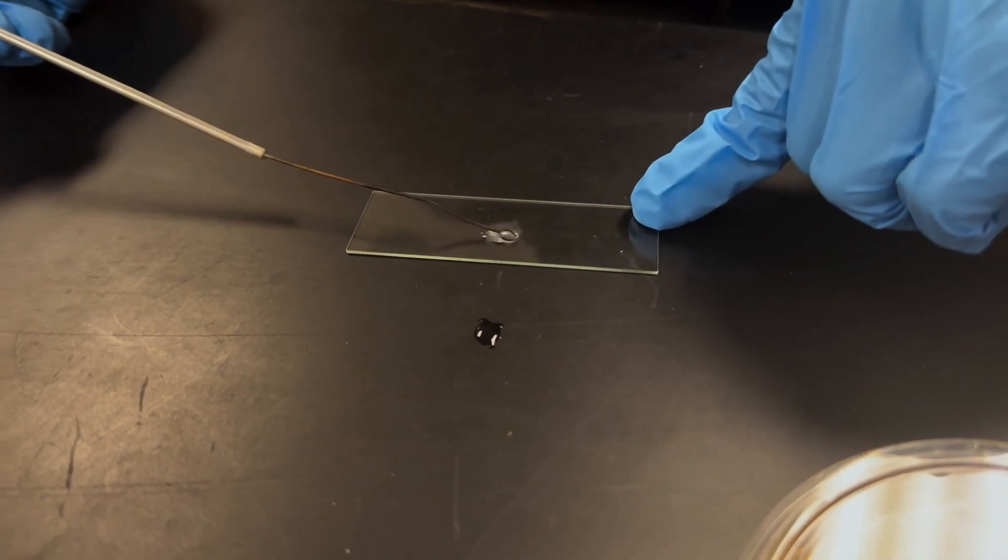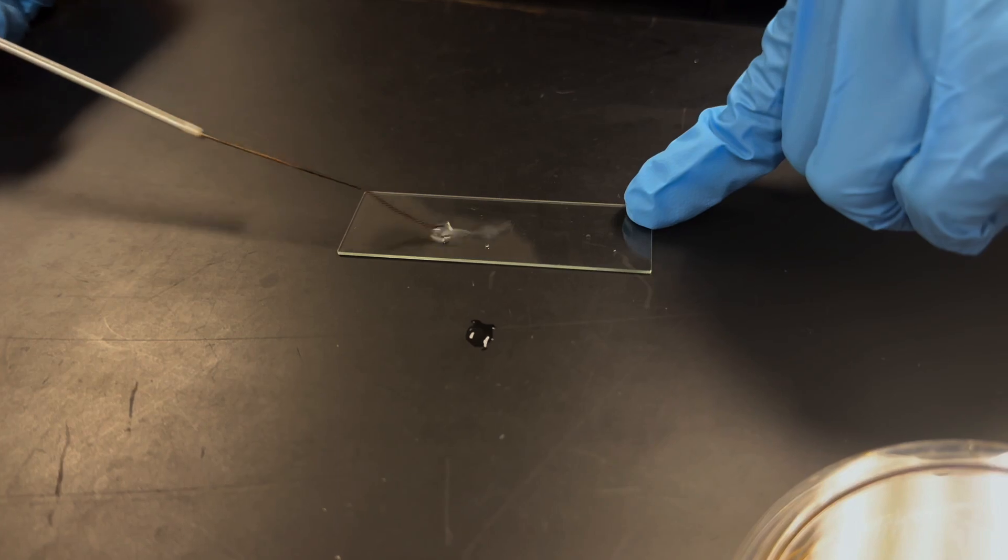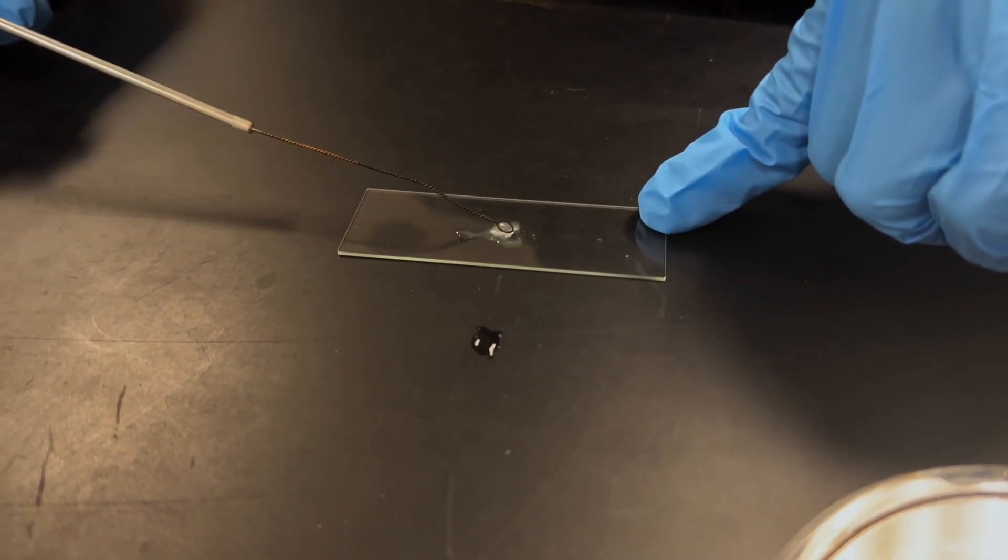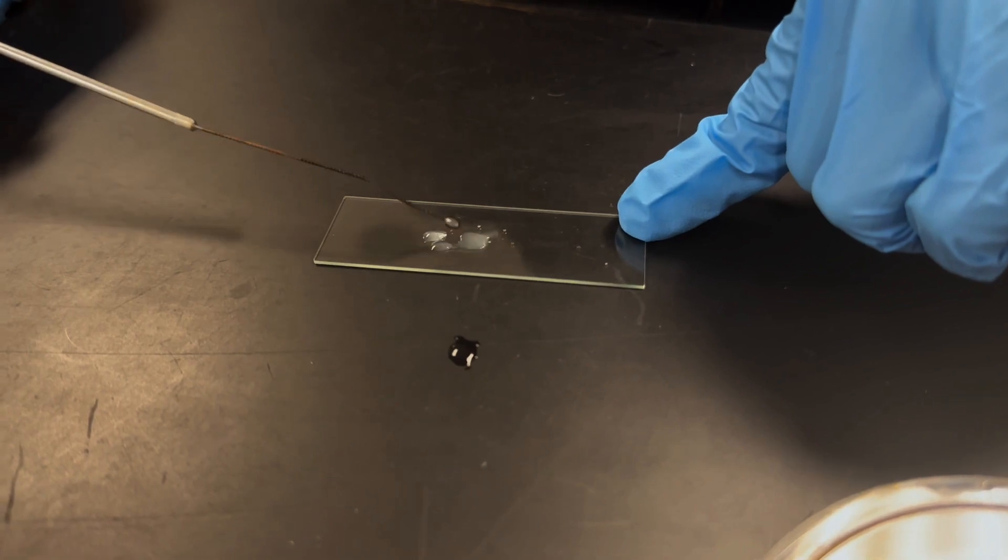And if you're able to kind of spread the bacteria out a little bit on the slide, it will end up drying faster, which will help speed up the process.